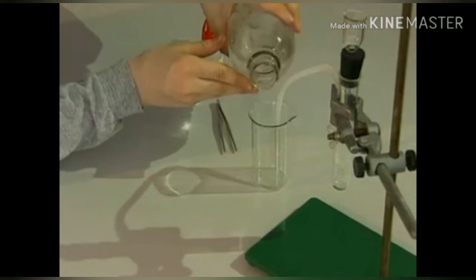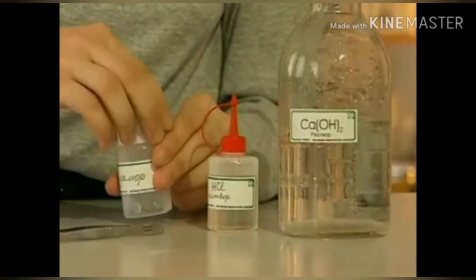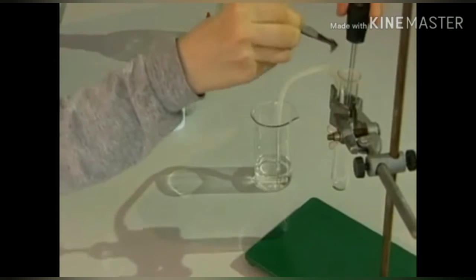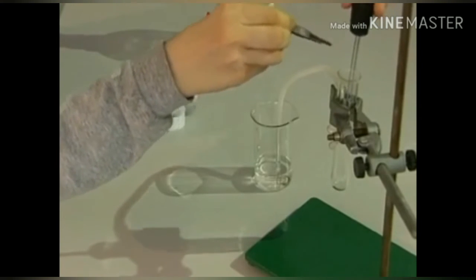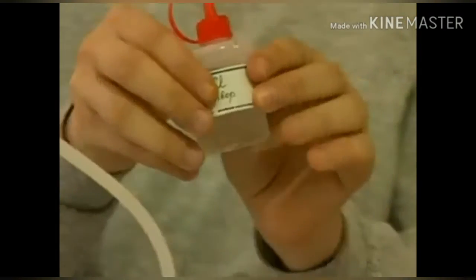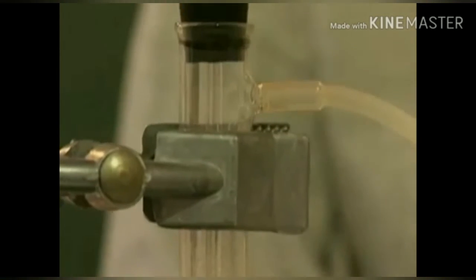We get carbon dioxide by the interaction of dilute hydrochloric acid and the calcium carbonate marble. Through the tube, carbon dioxide is fed into a glass with lime water. This is solution of calcium hydroxide. A small amount of carbon dioxide entering the solution reacts with water to form weak carbonic acid. Carbon dioxide is detected by the turbidity of lime water by the precipitation of calcium carbonate.